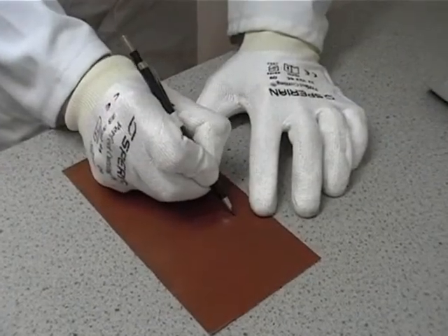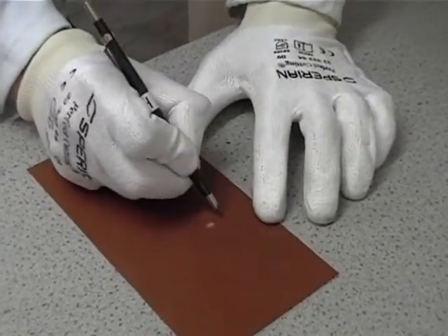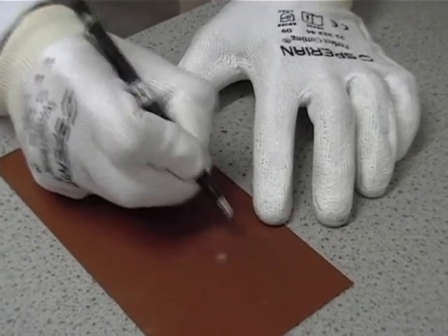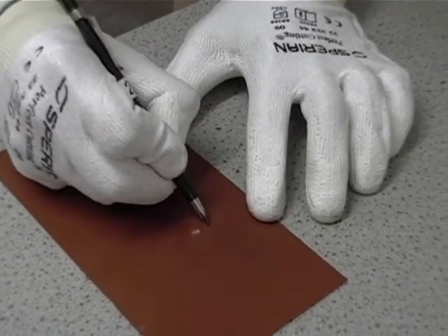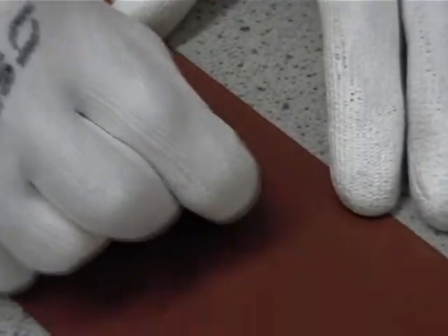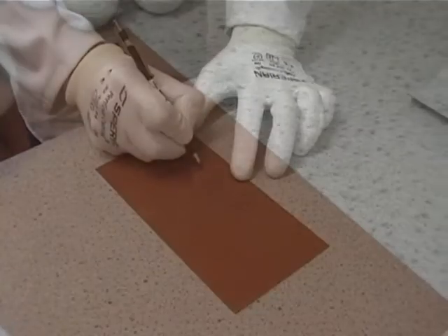Using an even force, this is then pushed along the test specimen at an angle of 45 degrees. To ensure reproducibility when using this manual method, the scratch can be repeated three times as shown here. Any marking from the pencil is erased before inspection.